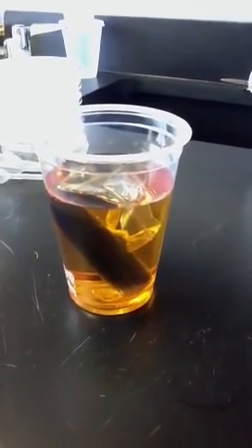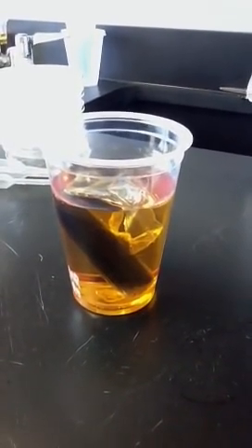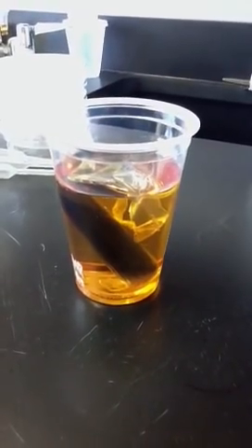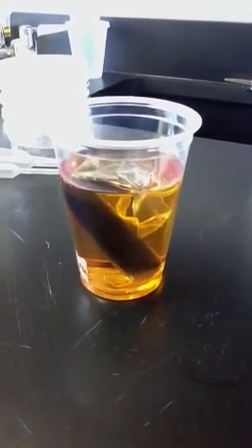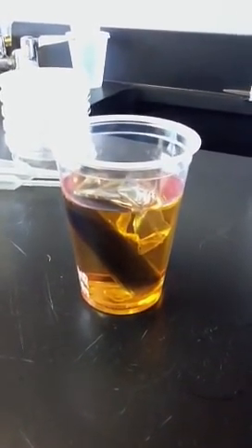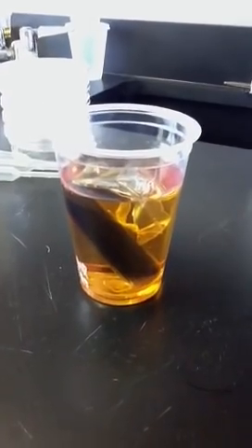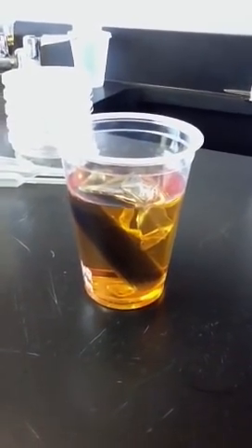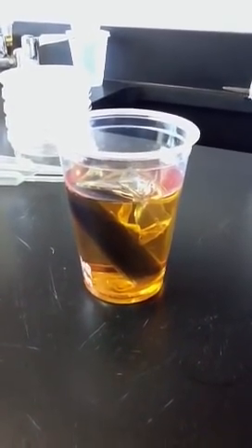Hello everyone, Mrs. D here. This cup is part of Lab 1 in AP Bio, the Diffusion Osmosis Lab. Part 1, or Exercise 1, investigates diffusion across a semi-permeable membrane.